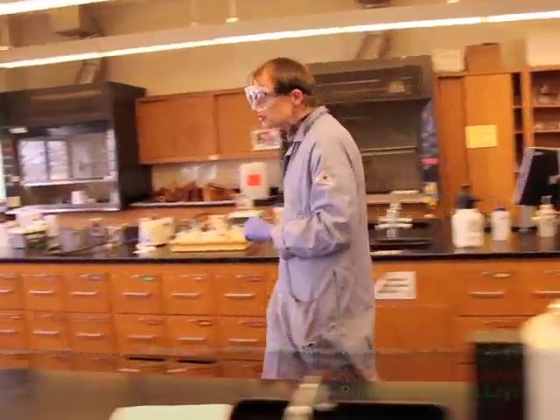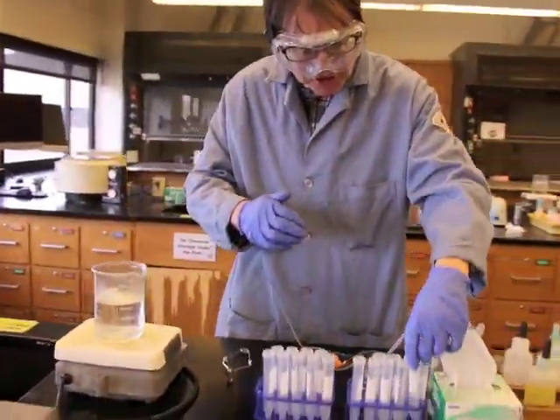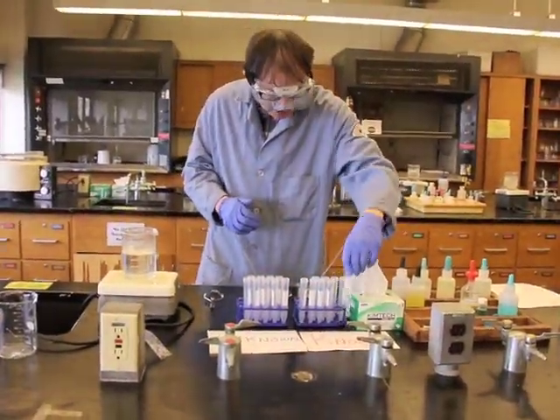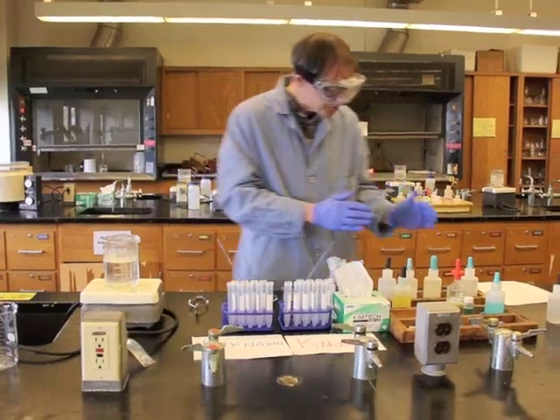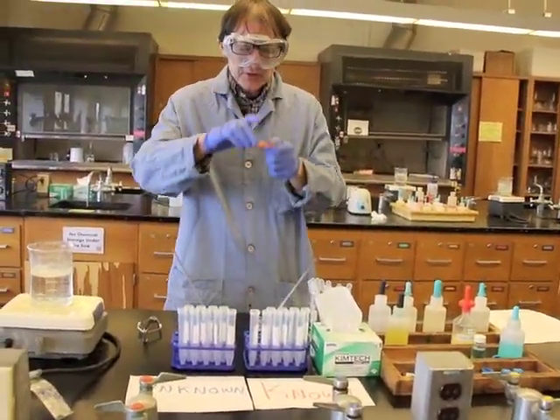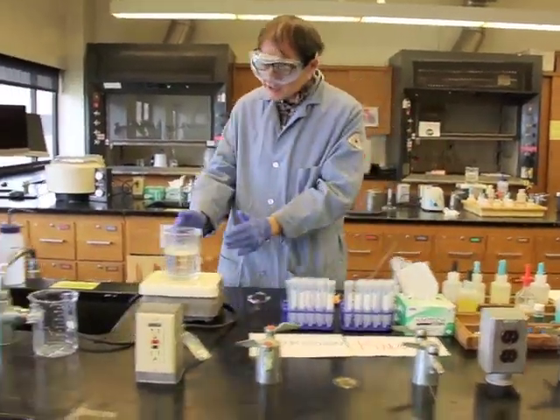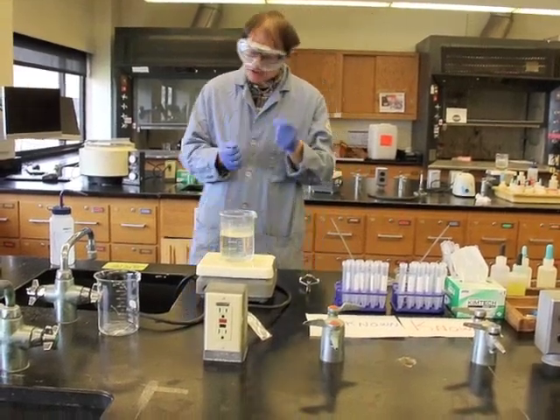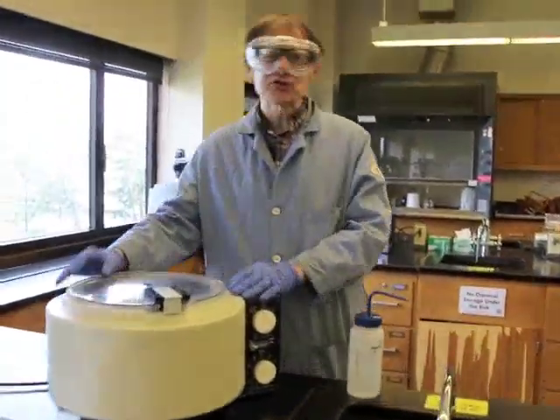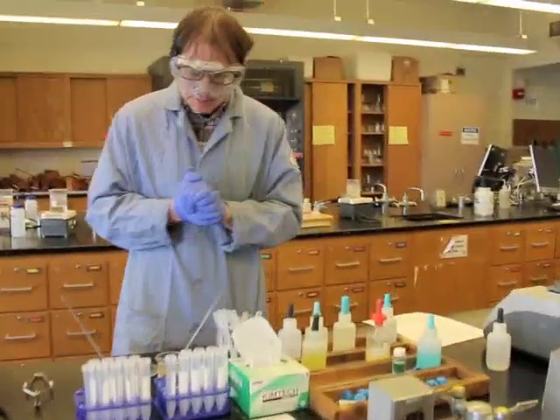So over here, this is our workstation. Right here we have the centrifuge test tubes, which are plastic tubes. We also have reagents. The reagents are over here, as are our group solutions, and we have pH paper, which I'll discuss in a few moments. We have boiling water here, which we'll need in order to get the reaction started. We also have a centrifuge, which we will use to separate the supernatant from the precipitate.